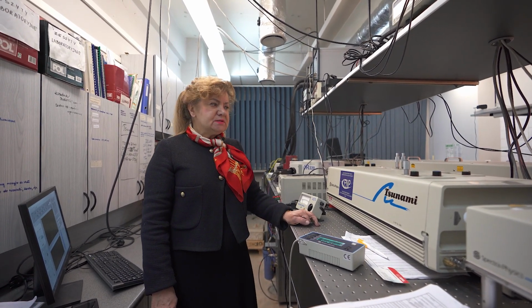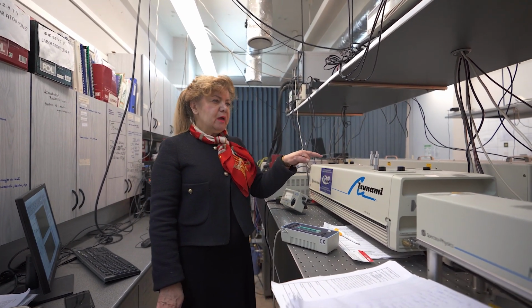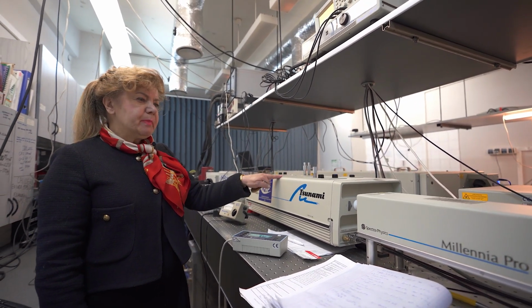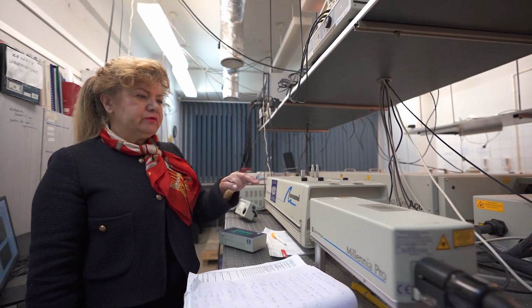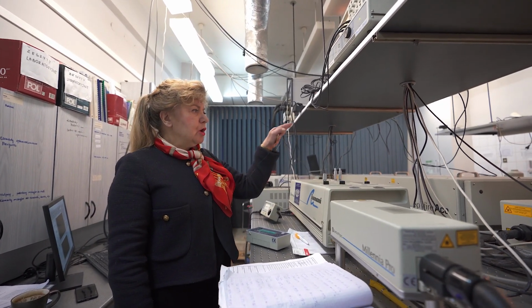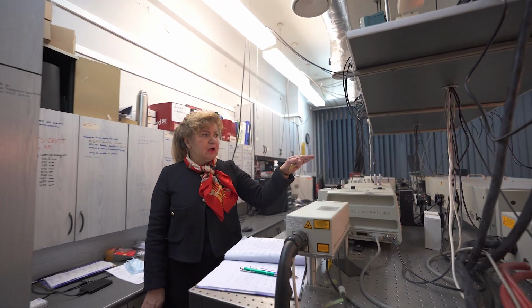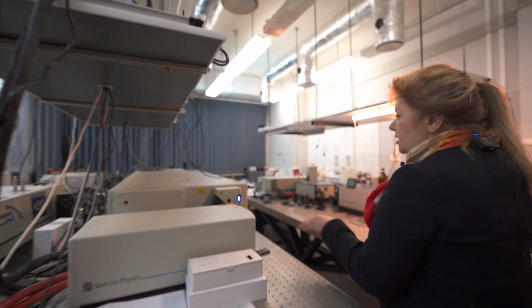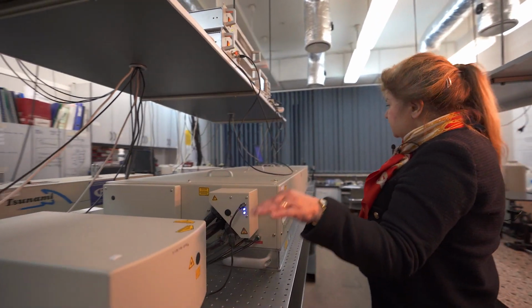cell functions. We are in our fourth laboratory of femtosecond spectroscopy using nonlinear optics. The femtosecond system consists of a femtosecond laser emitting pulses of 100 femtoseconds. The laser is pumped by the green line of the diode laser. The single pulse from this laser goes to the regenerative amplifier, where it is amplified. Of course, the regenerative amplifier is also pumped by another laser.